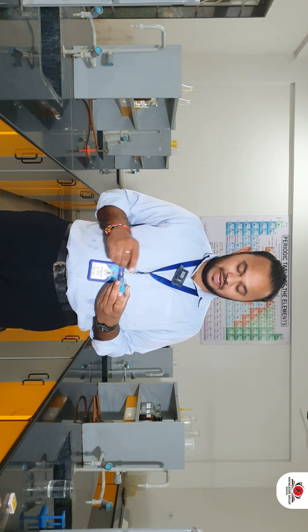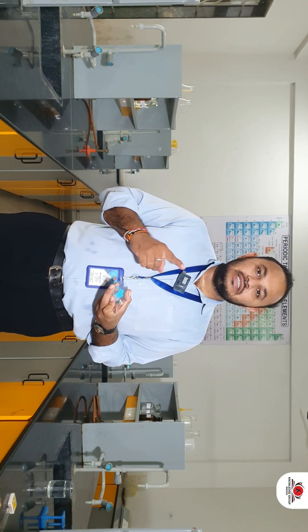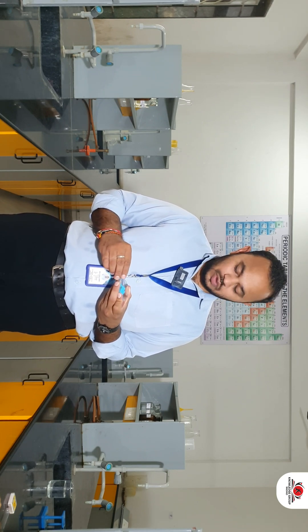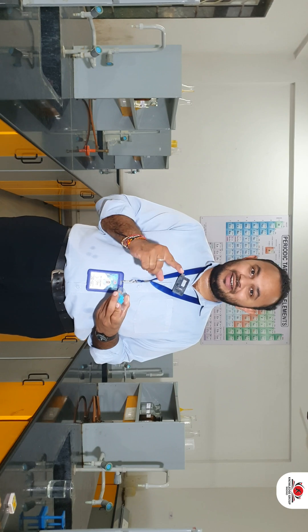Hello students. As we studied in Chapter 2, some salts have a crystal form because they contain water in the form of water of crystallization. Here we are taking copper sulfate. We already know that there are five water molecules present in one unit of copper sulfate salt. So is it really dry or wet? Because in the formula of copper sulfate we write 5H₂O — so why do we write 5H₂O? Is it really wet or dry? Today we will find the answer.